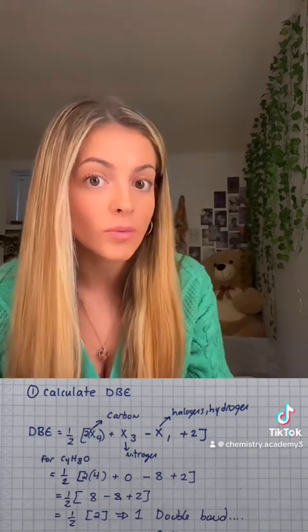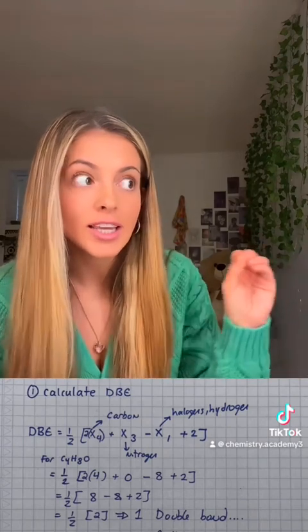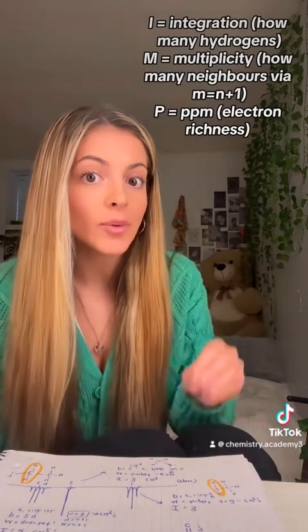So given our formula, we could say there's carbons, there's an oxygen, maybe a ketone. So I'm just going to put this in my little legend, ketone possible. Then I go straight to the spectrum. Peak by peak, I do IMP.